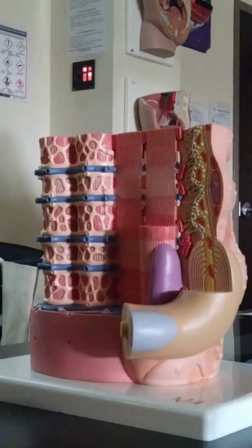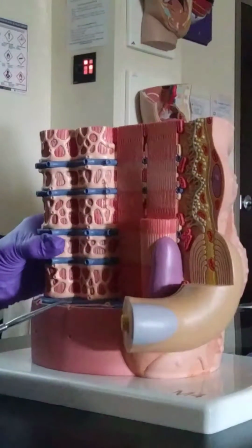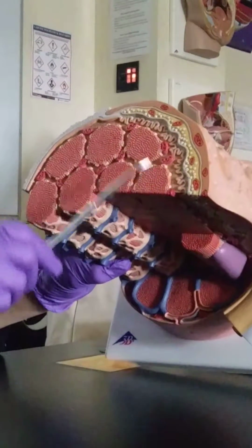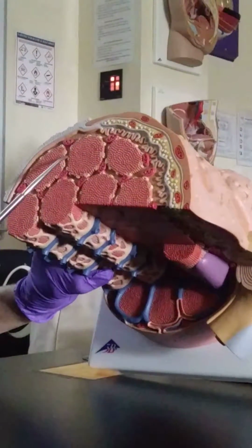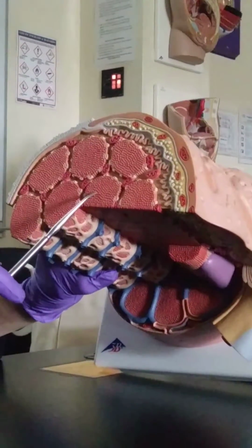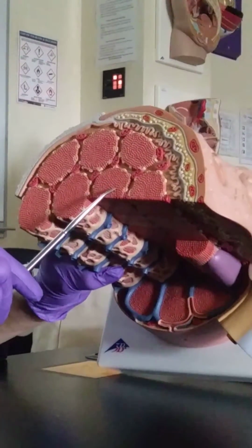And we can tell that it's a muscle fiber because we can see the organelles inside of it. And if we look over here to the side, we know already that that muscle fiber is made up of myofibrils. So each one of these circles would be one myofibril. Here's a second, here's a third. Notice the little dots. Remember that myofibrils are made up of myofilaments. So each of these dots are those thick and thin myofilaments.